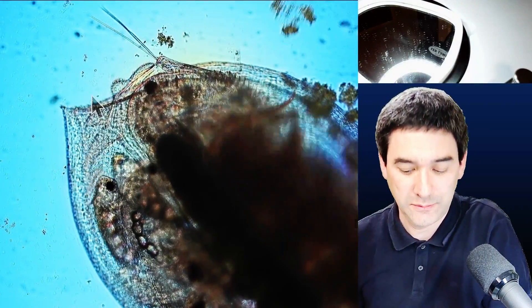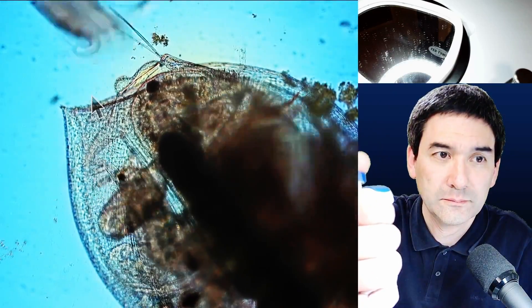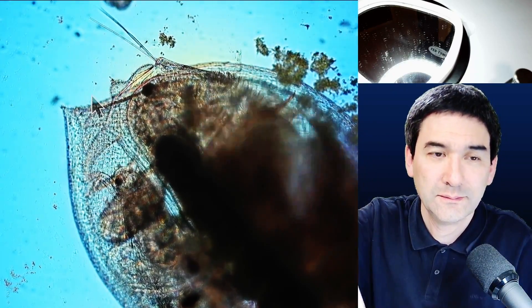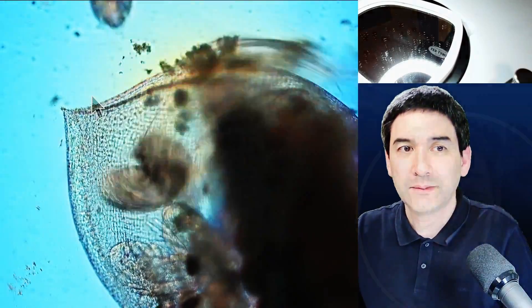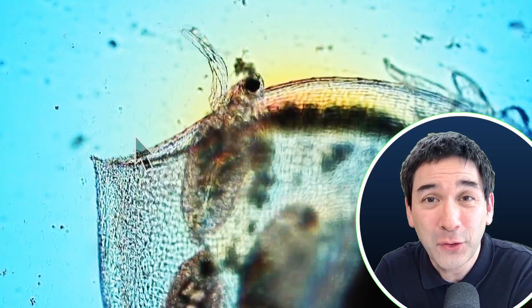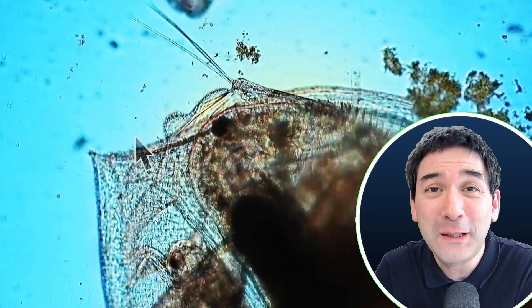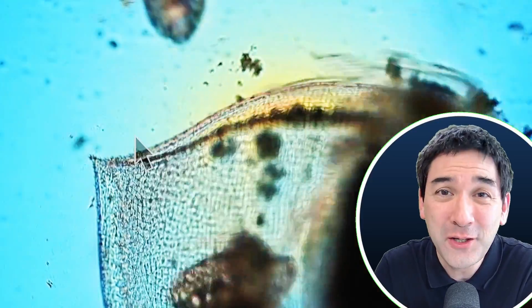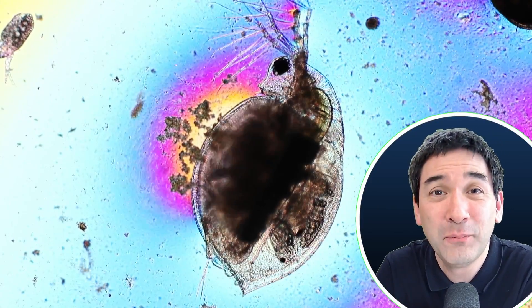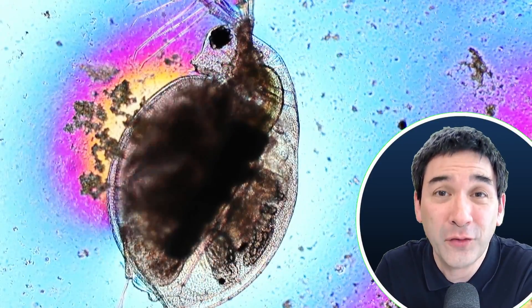A few days ago I gave a live stream and I was simply demonstrating a few water fleas, concentrated on something totally different, and then all of a sudden one of the water fleas gave live birth. Someone in the chat actually informed me about that, but I completely missed it. But I continued to observe the water flea later on and I was able to see that it continued to give birth to several more offspring, those babies.